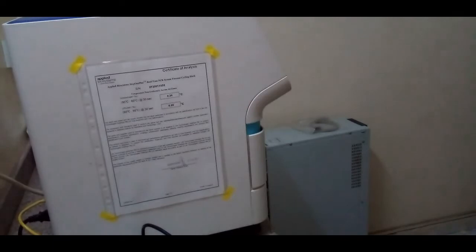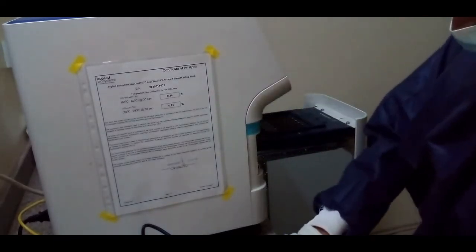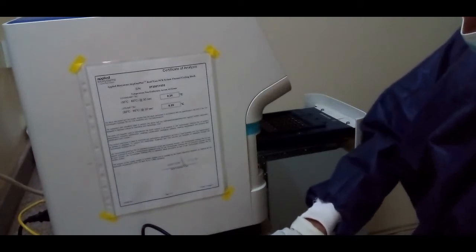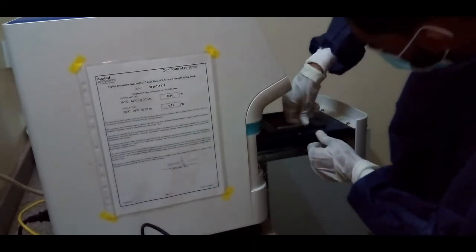Here is the PCR machine. Place the PCR tube inside the PCR machine.